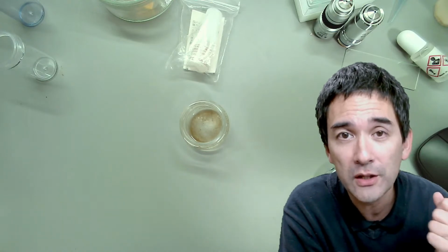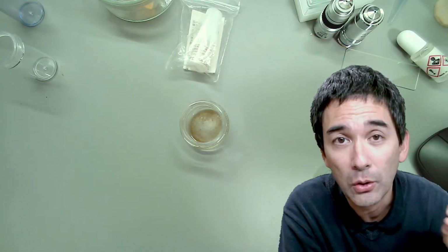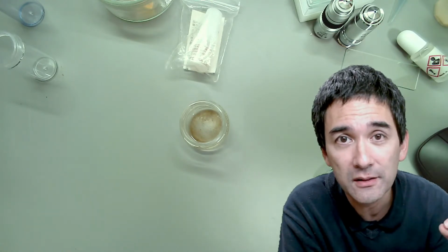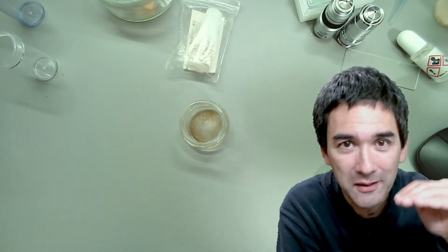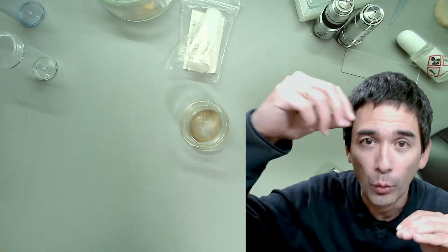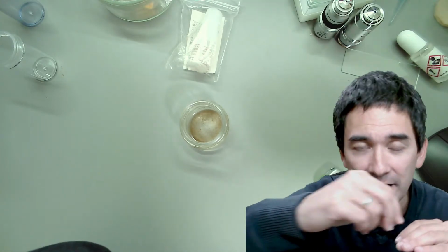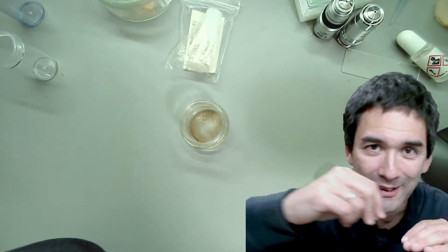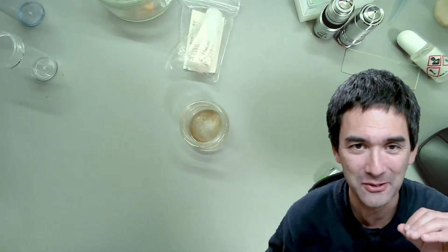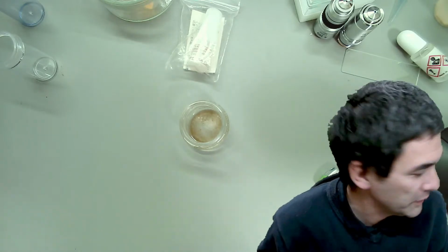The second reason why you need a very thin layer of water is because otherwise the cover glass is swimming. When it's swimming on the surface and you have oil on top of it, then every time you focus and move the slide, it's going to drag along the cover glass. So it's got to be very thin. Okay, so let's do that.